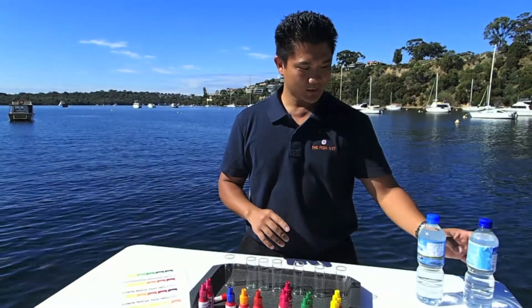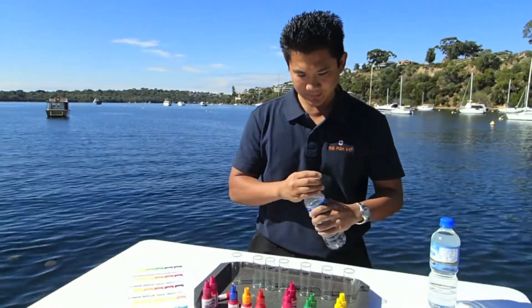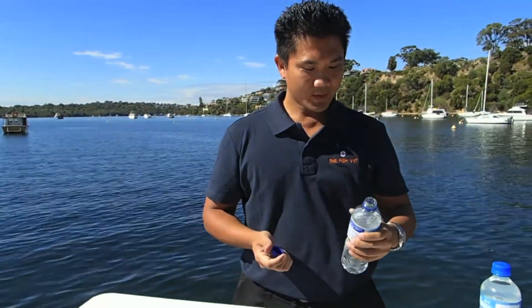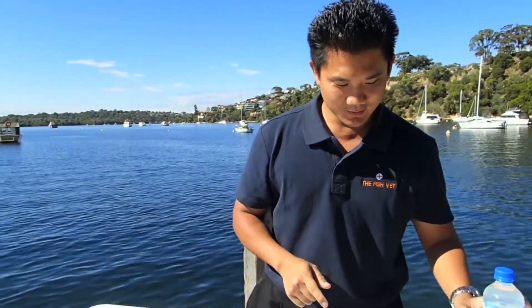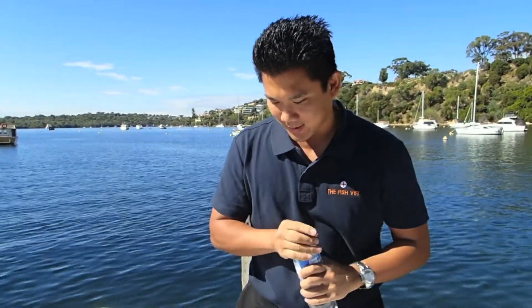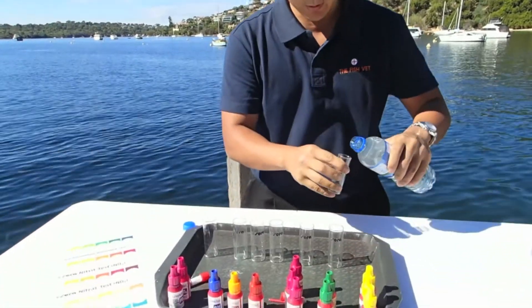So first thing to test the water is you get the water, you open it up, and then you taste it. Good. Make sure you taste the correct water, because this is the water that we're going to be testing. So before we start, we always rinse the jars off with the water that you're going to be testing.